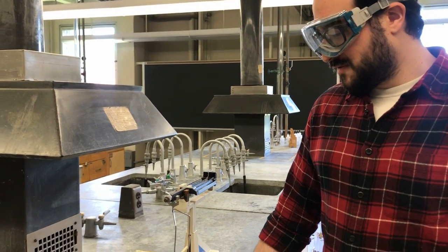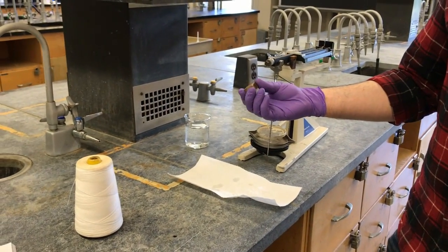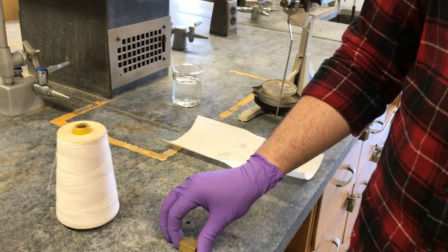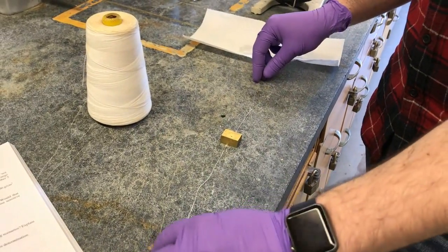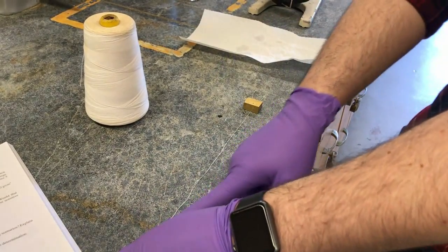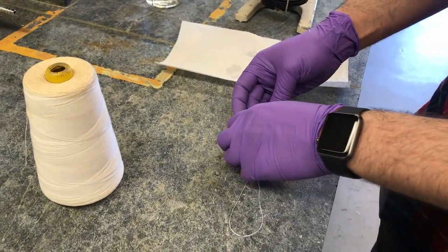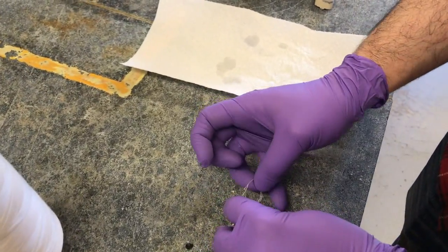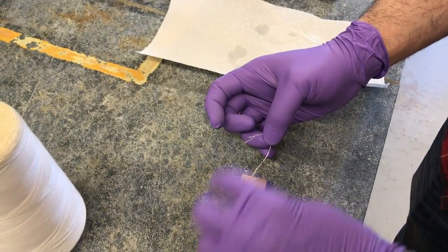So for part 3, for the Archimedes method, what you'll first have to do is dry your solid, because we're going to be weighing it in air first. But to do that, we need to tie it along a string. The easiest method is making it into a loop over here. You're going to pass the string through here. I don't remember what this knot is called, but it's pretty easy. I mean, actually it's not that easy.